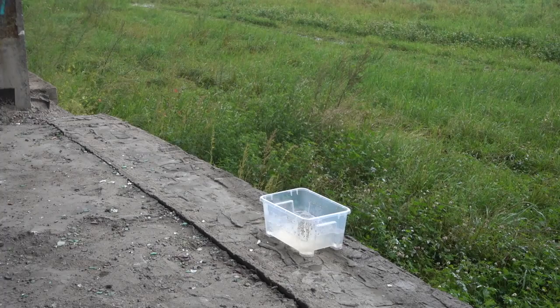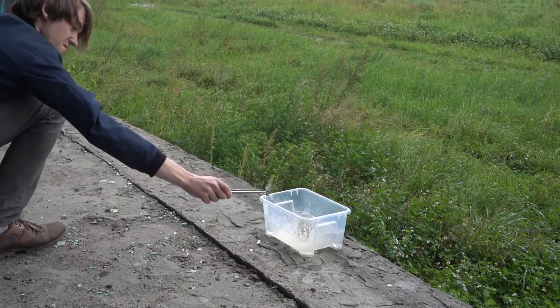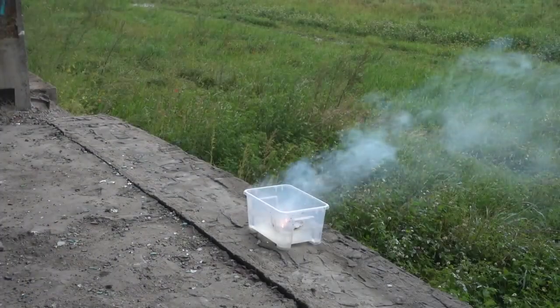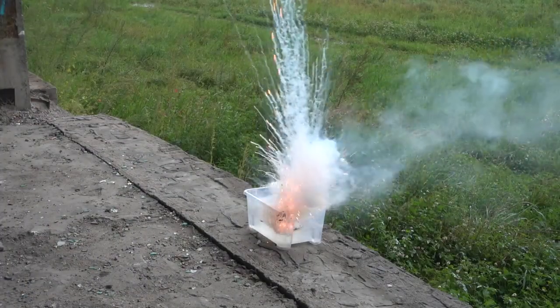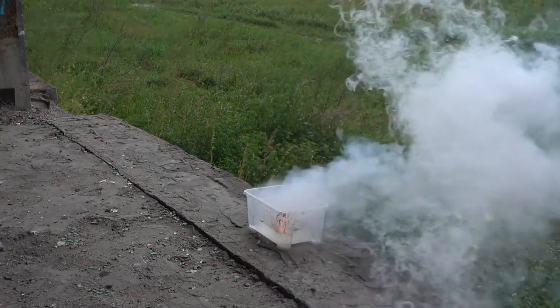Lastly, we decided to throw about 20 grams of cesium in containers filled with ice water. As you can see, cesium explodes at the first contact with water, although not so strongly as it's sometimes portrayed in other videos.